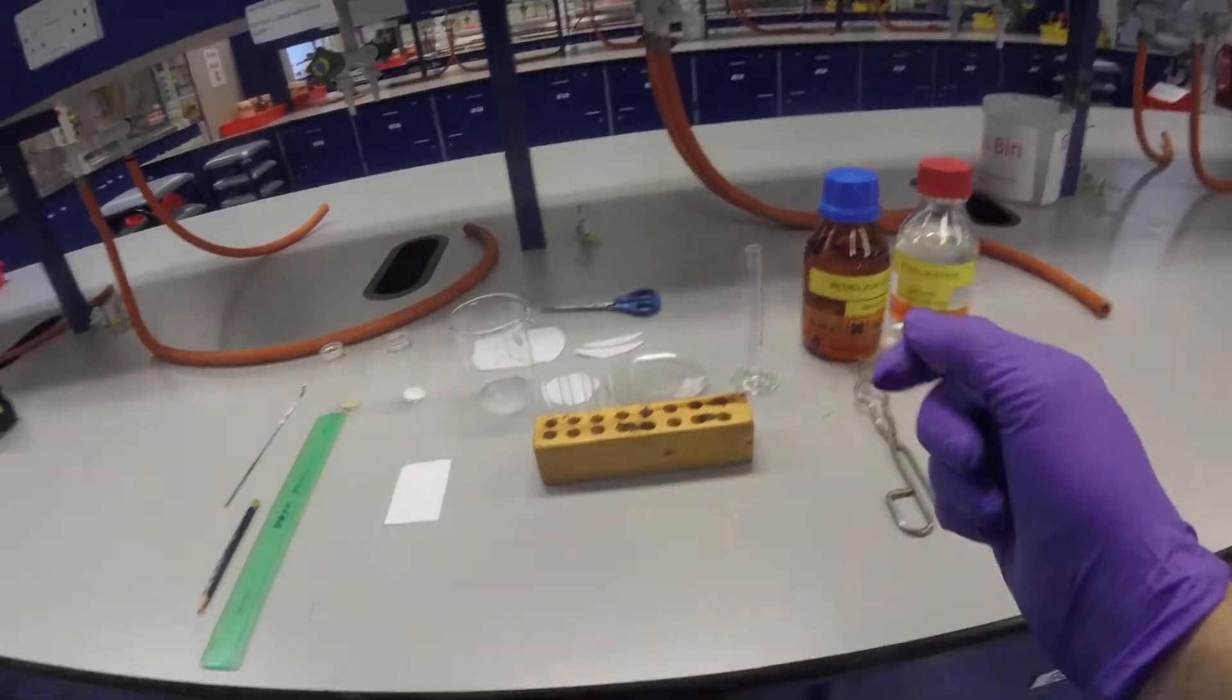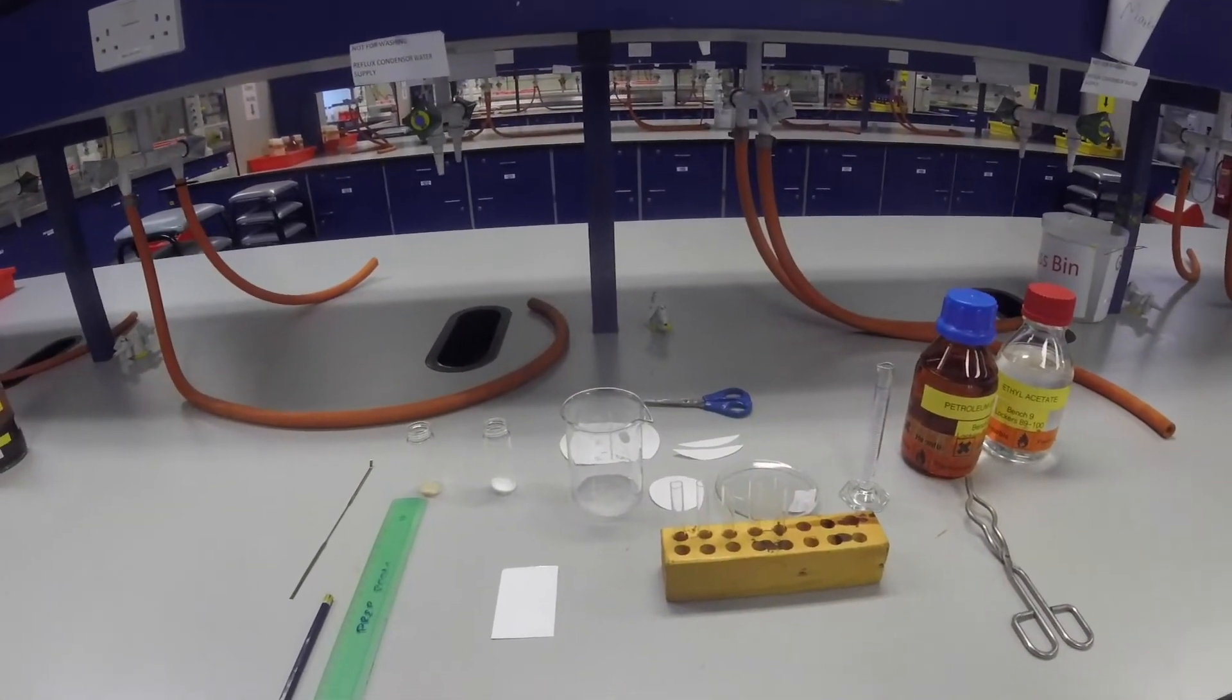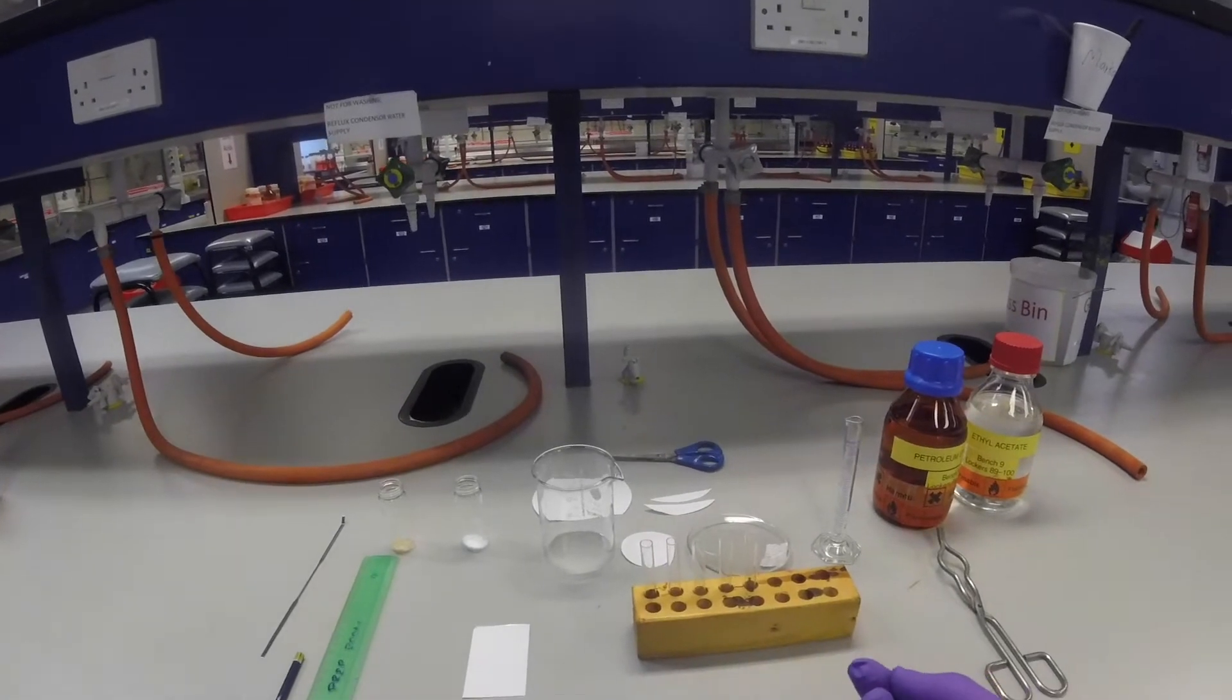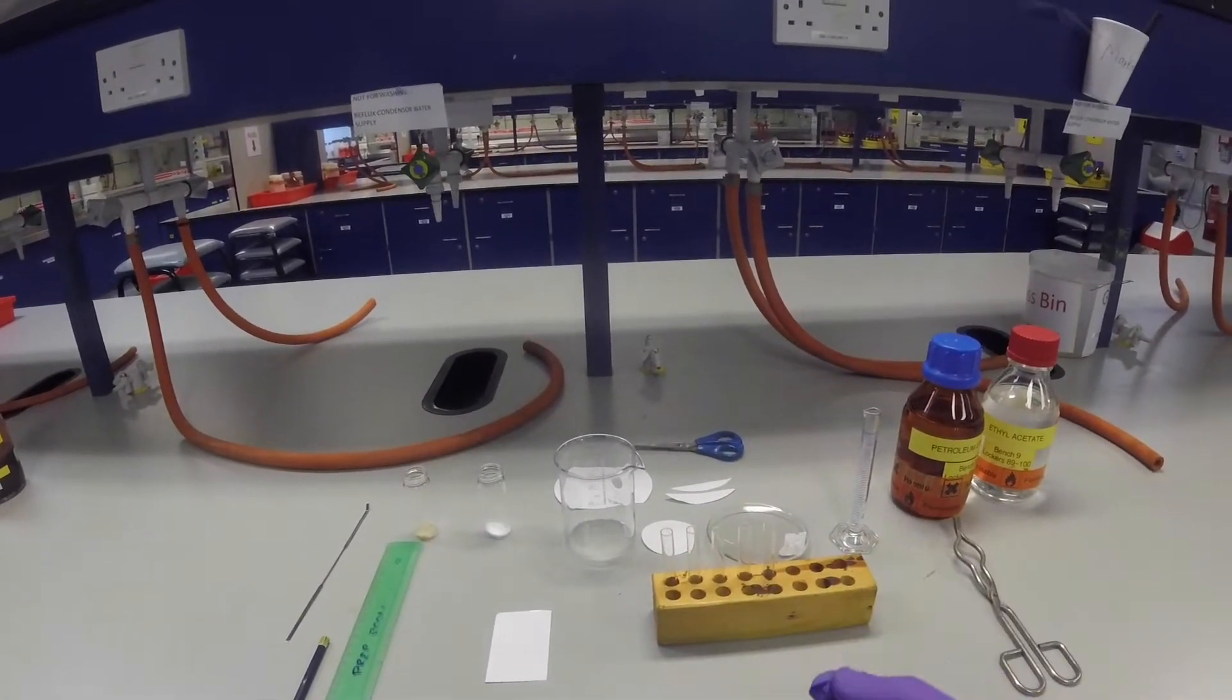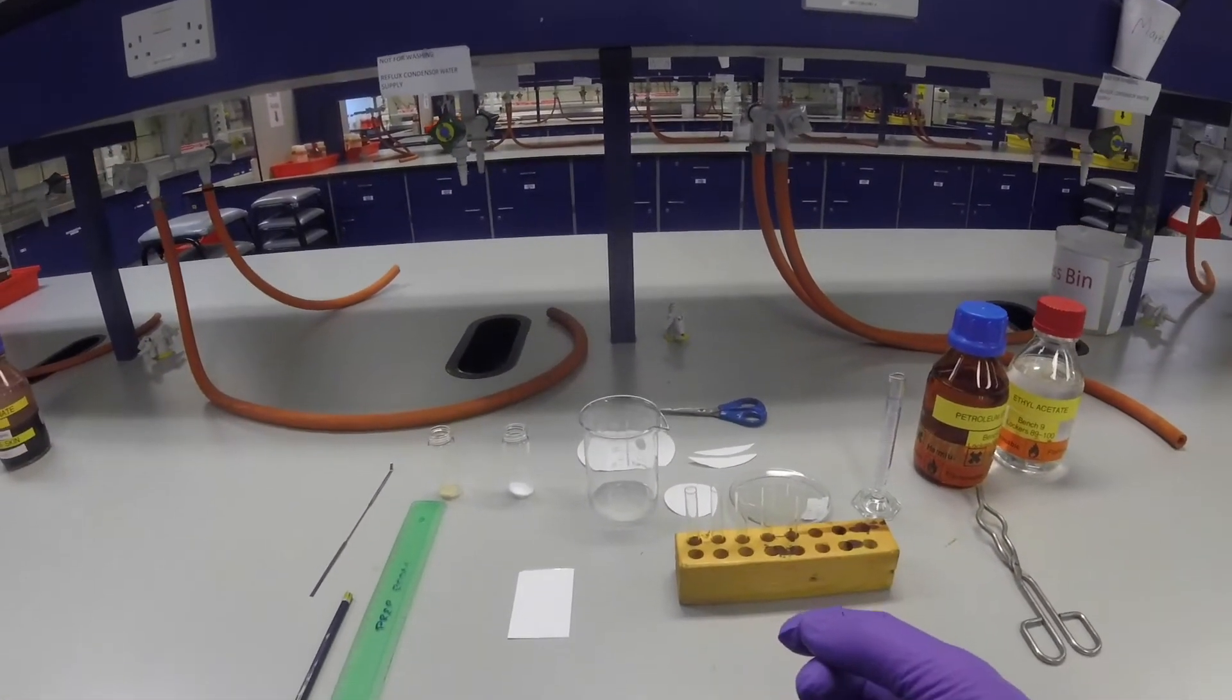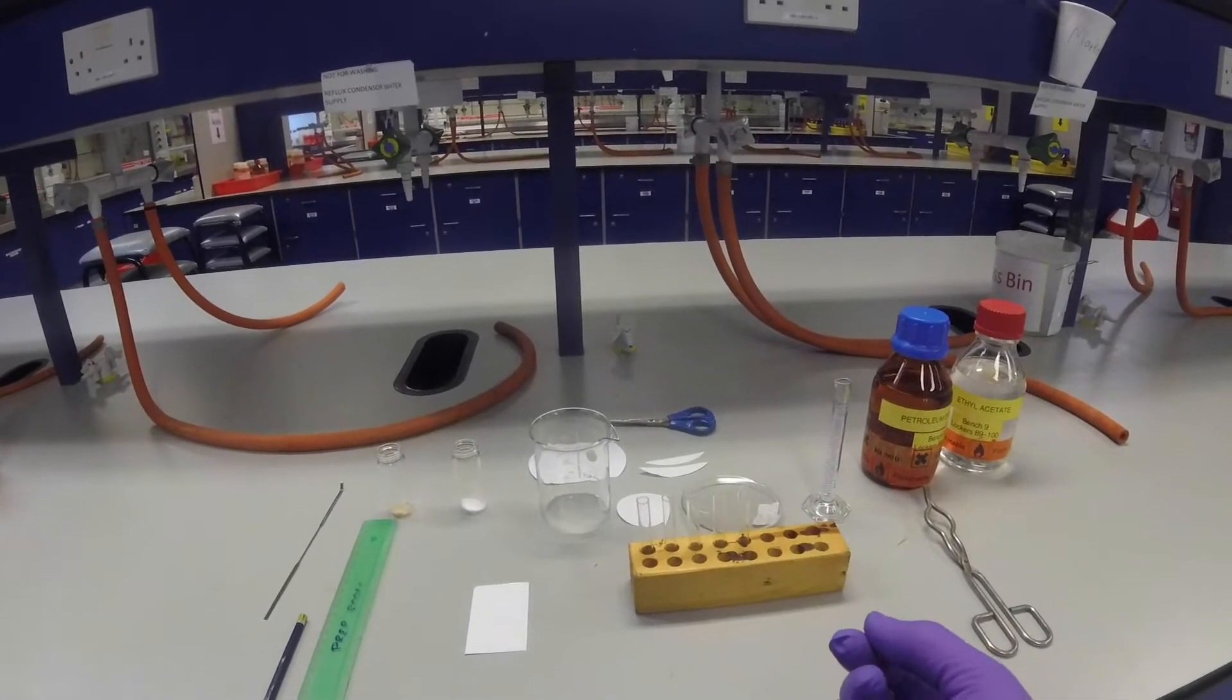This video is a little guide on how to do thin layer chromatography or TLC. TLC is a really useful technique in the laboratory for checking the purity of a compound you've got, comparing compounds against known other compounds, and checking the progress of a reaction you might be carrying out.